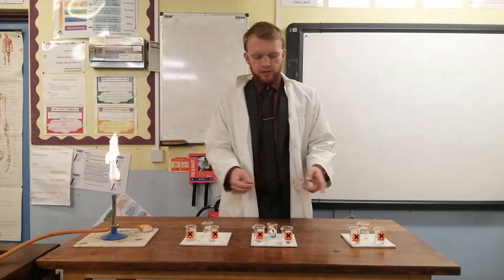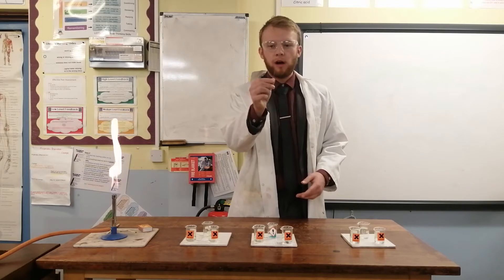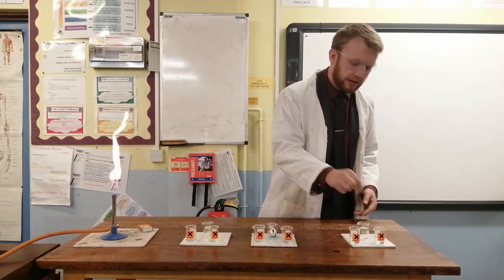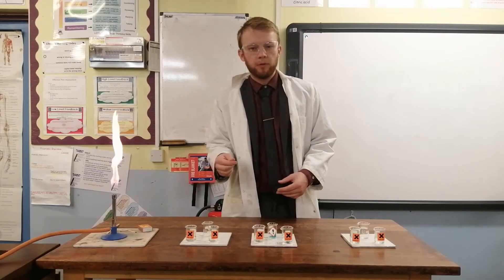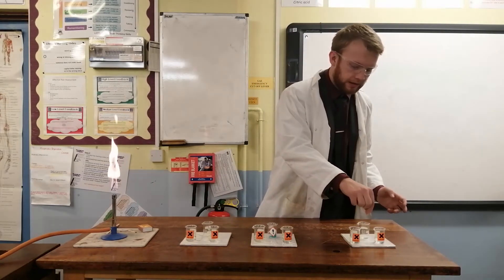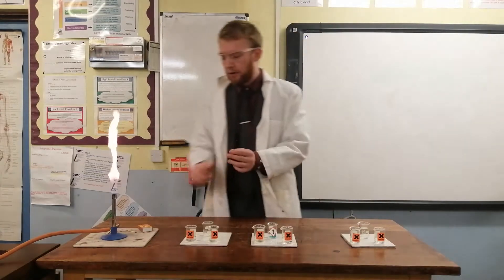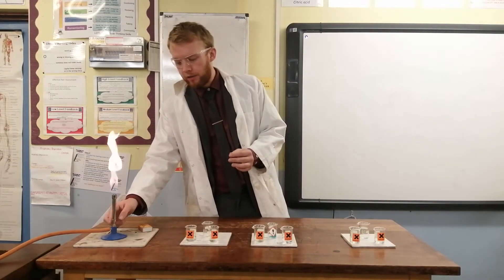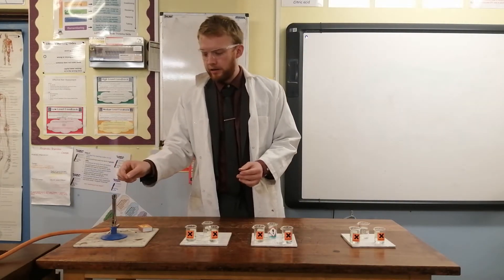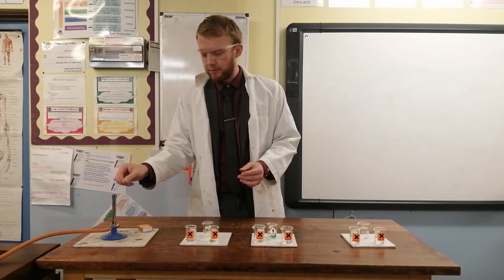For each of my unknown metal ions I've got a nichrome wire which I first need to clean to make sure there are no residual chemicals from a previous experiment on them. So I'm going to dip it in hydrochloric acid and run it through the blue Bunsen flame to ensure that there is no residue from another experiment.